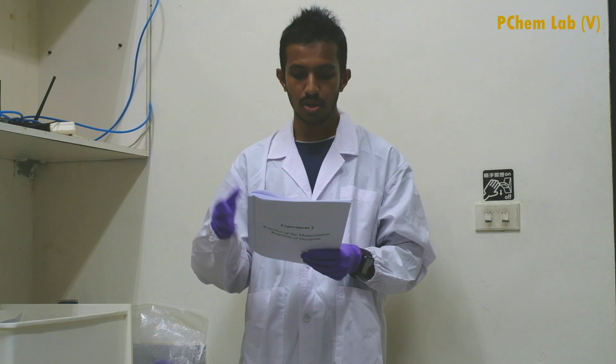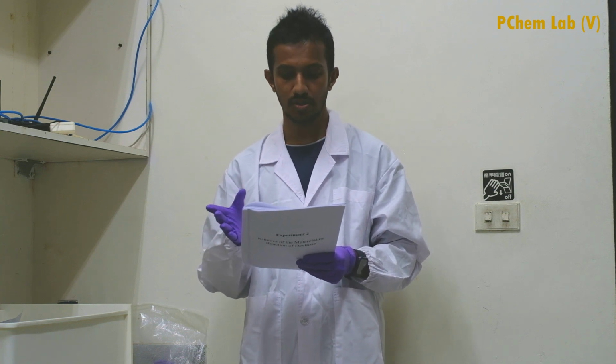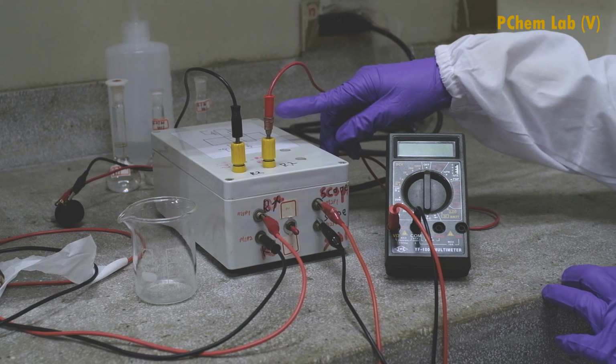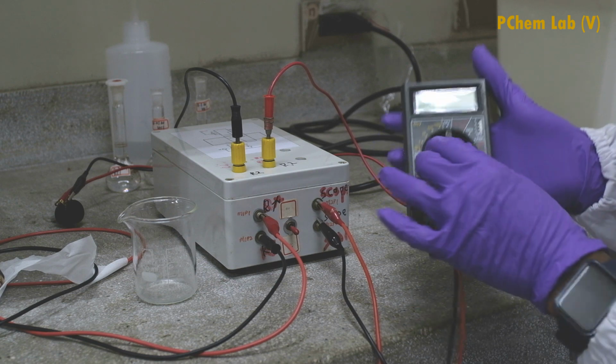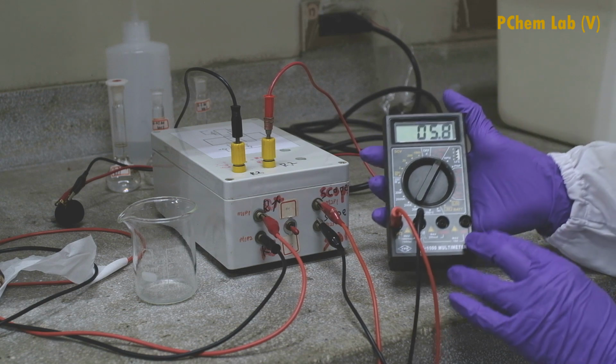After you clean the conductivity cell, now we are going to determine the cell constant of the conductivity cell. For that you have to measure the conductivity of the known concentration of KCl solution. For that we will use the 0.02 m KCl solution. Now I am going to measure the conductivity of the 0.02 m KCl solution. First, make sure the Wheatstone bridge is connected to the electricity. And in the multimeter, you have to turn the position to ACV 200.